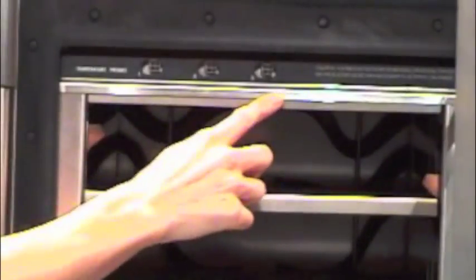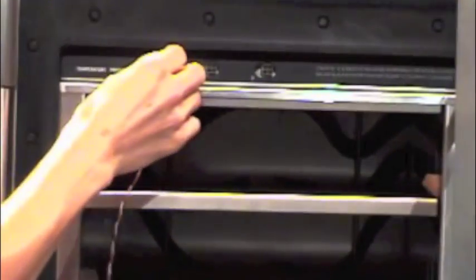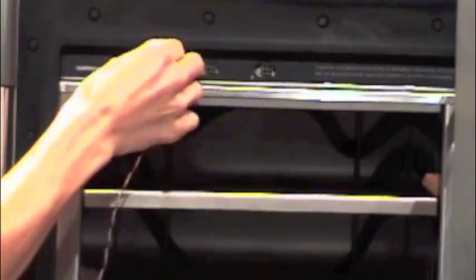Three temperature ports which connect to three probes allow constant sample monitoring.